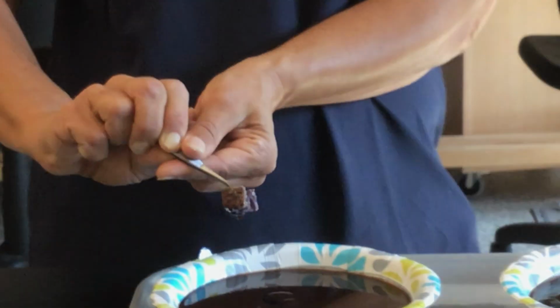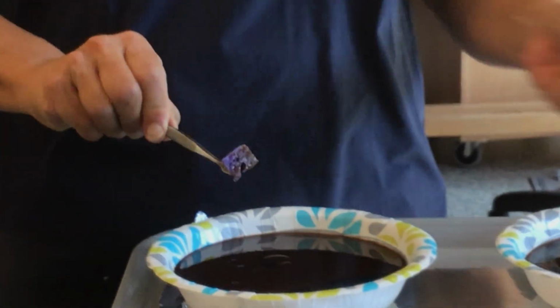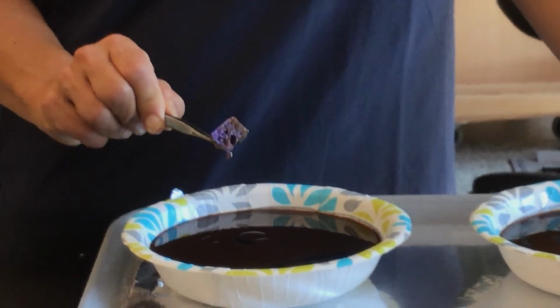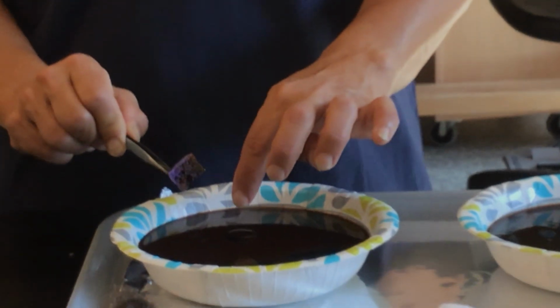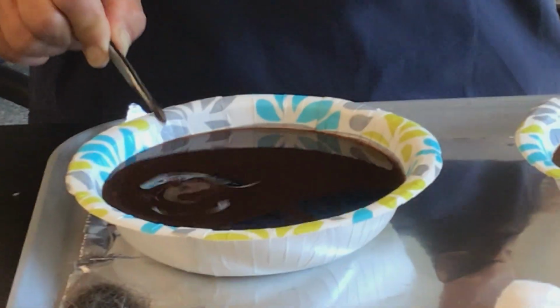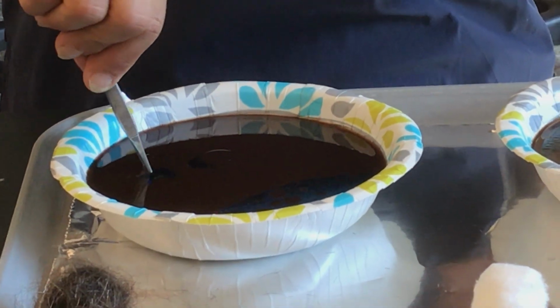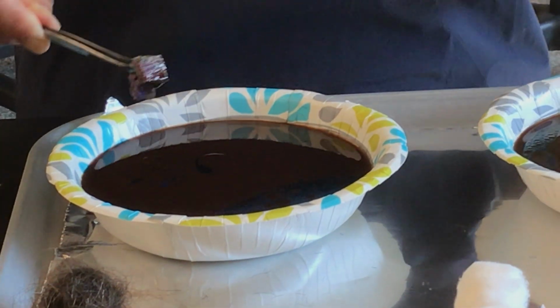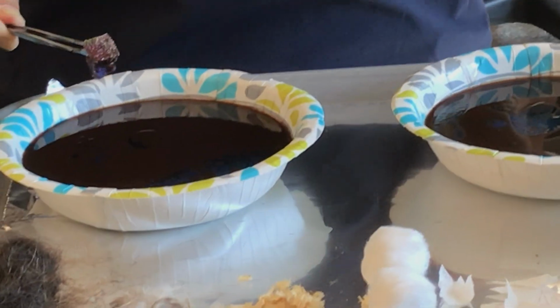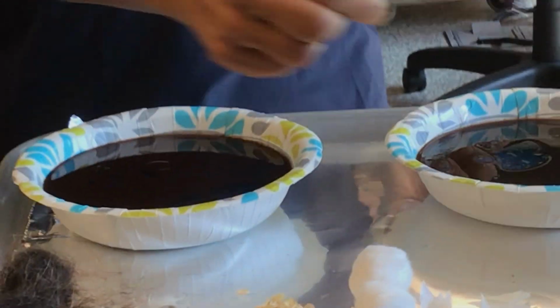Okay, you need to make the observations. Do you see as much oil on the sponge as you did in the salt water? And is the water as clear? Is there more blue water where there was oil compared to the salt water?